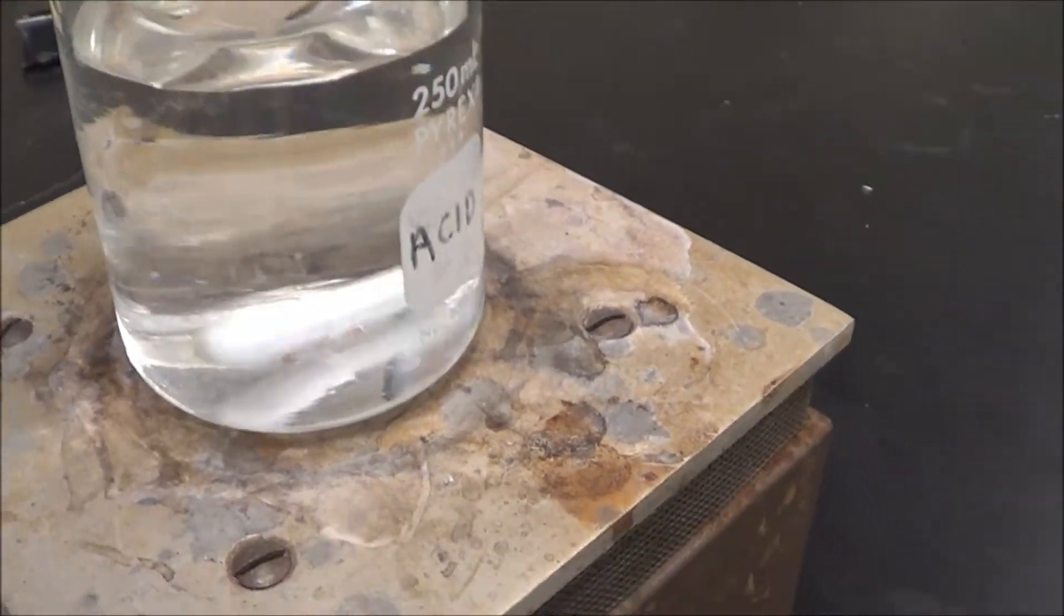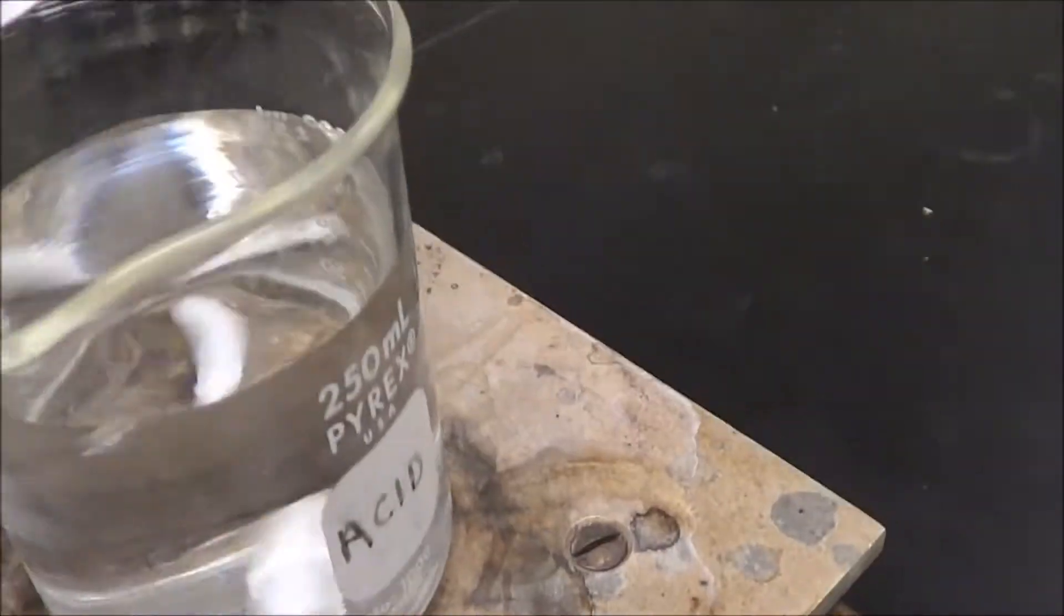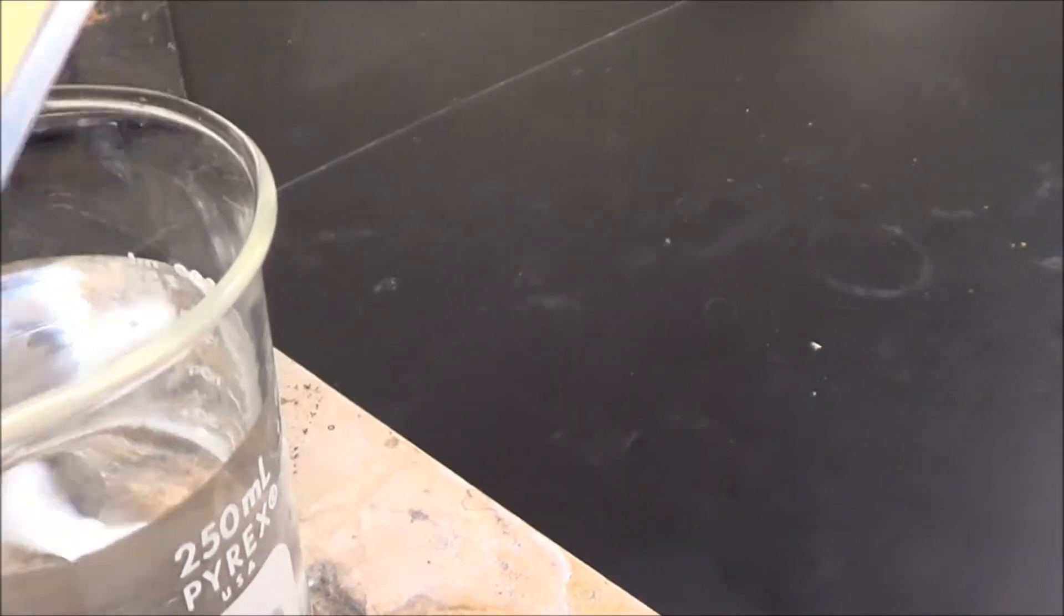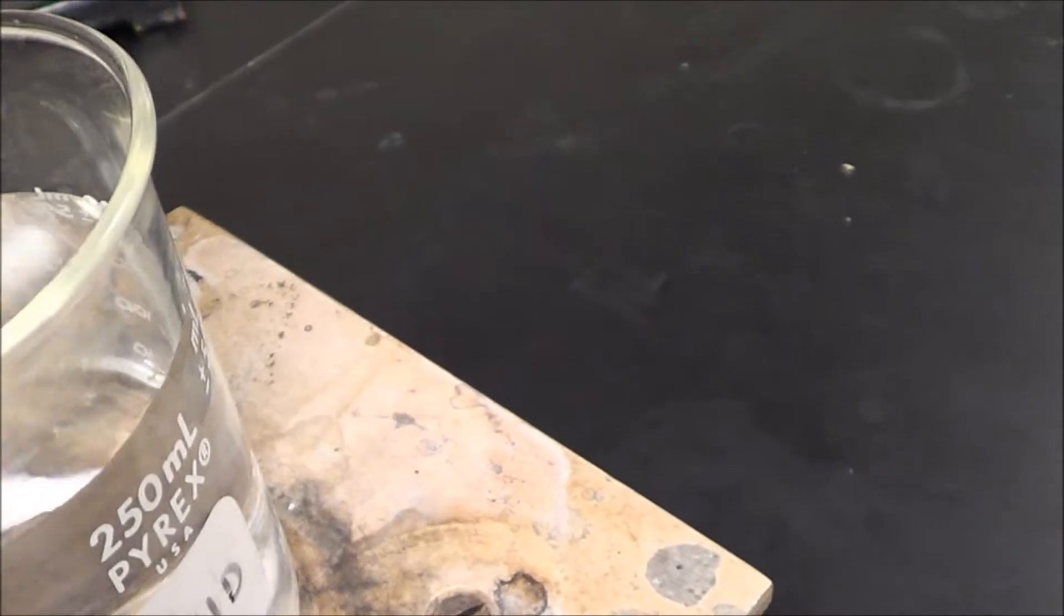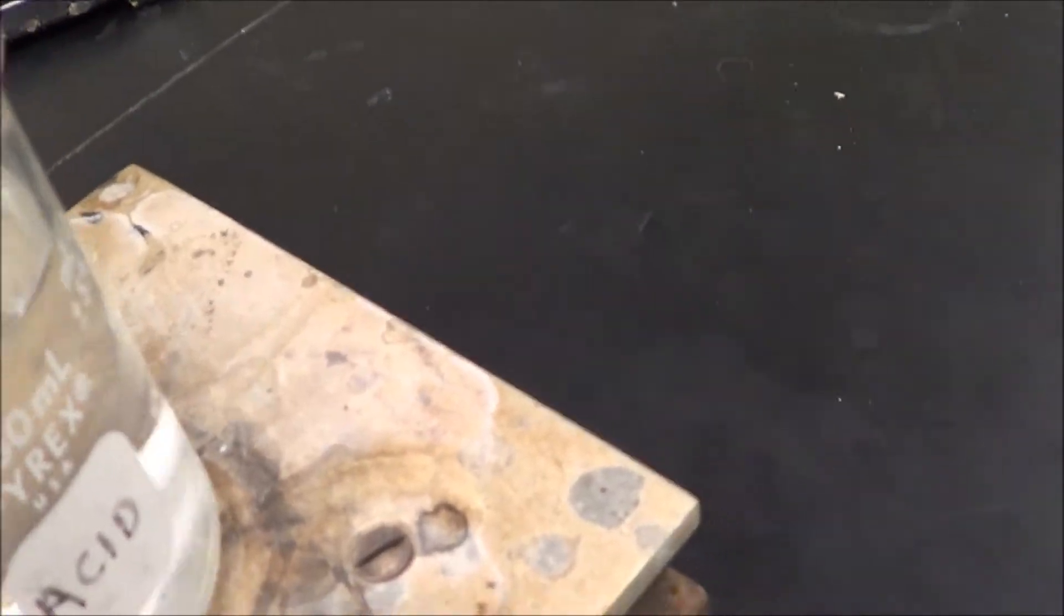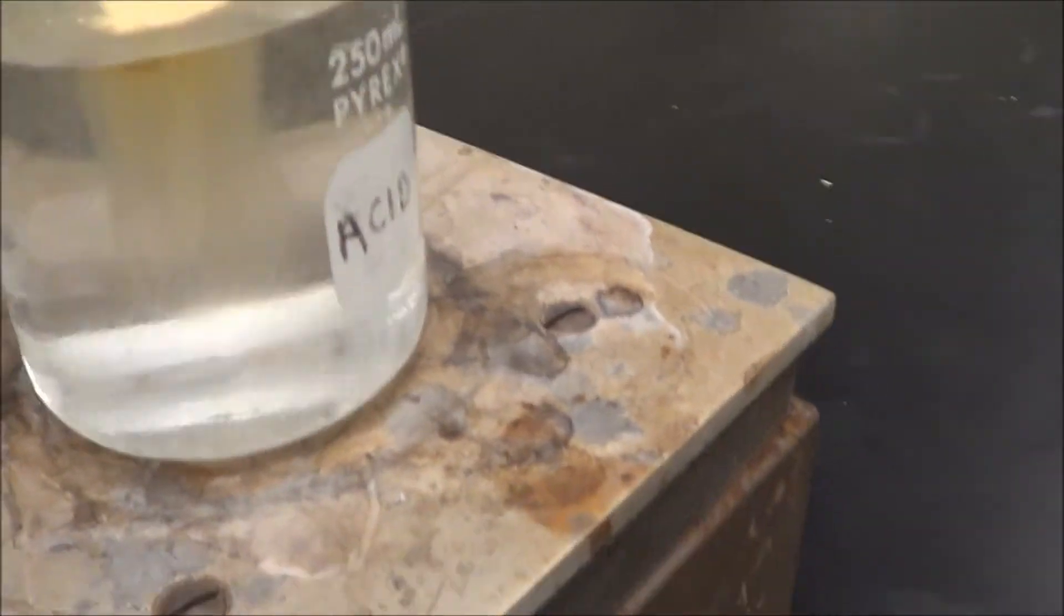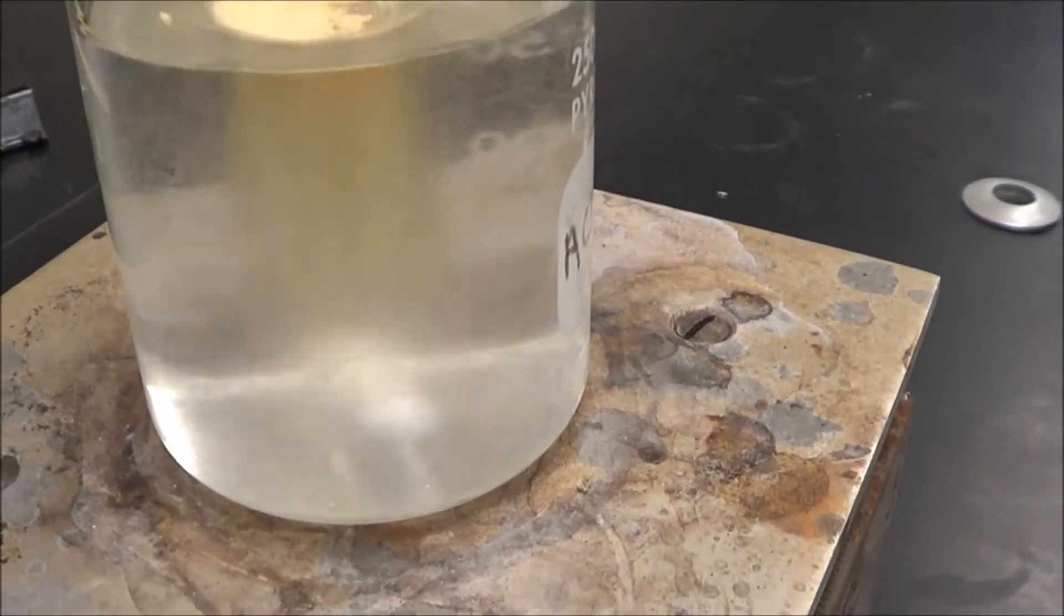It can't be tap water because it's not pure. So now we add it little by little. If we go too much it's going to get some big blobs in there. So it's going to start to stir it in here.